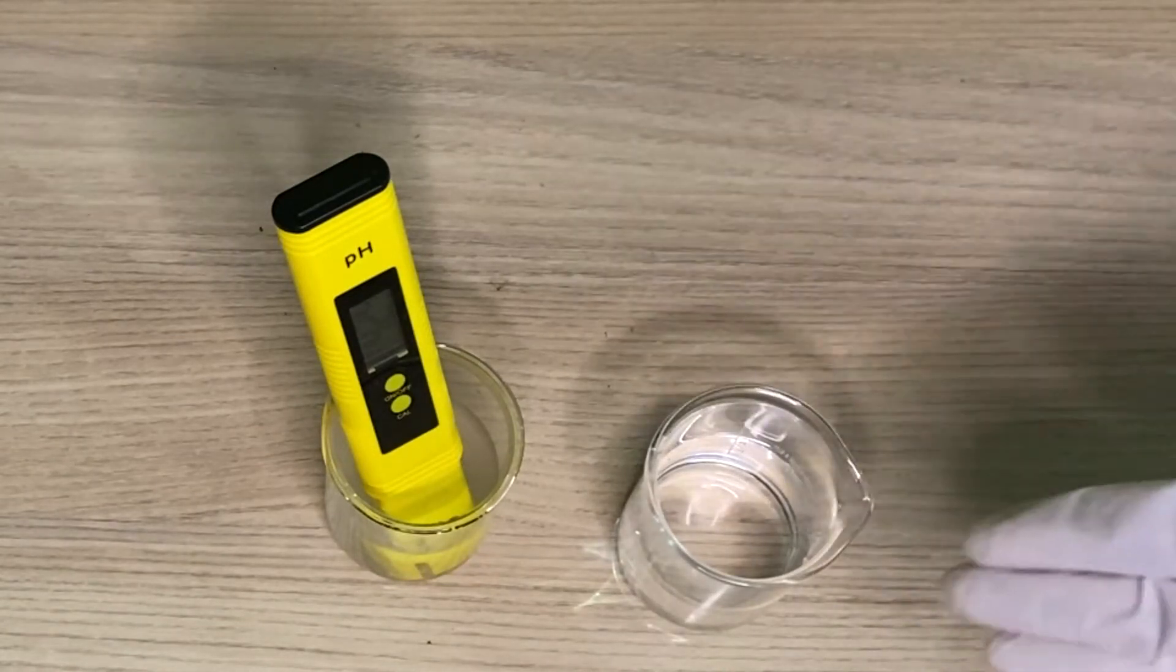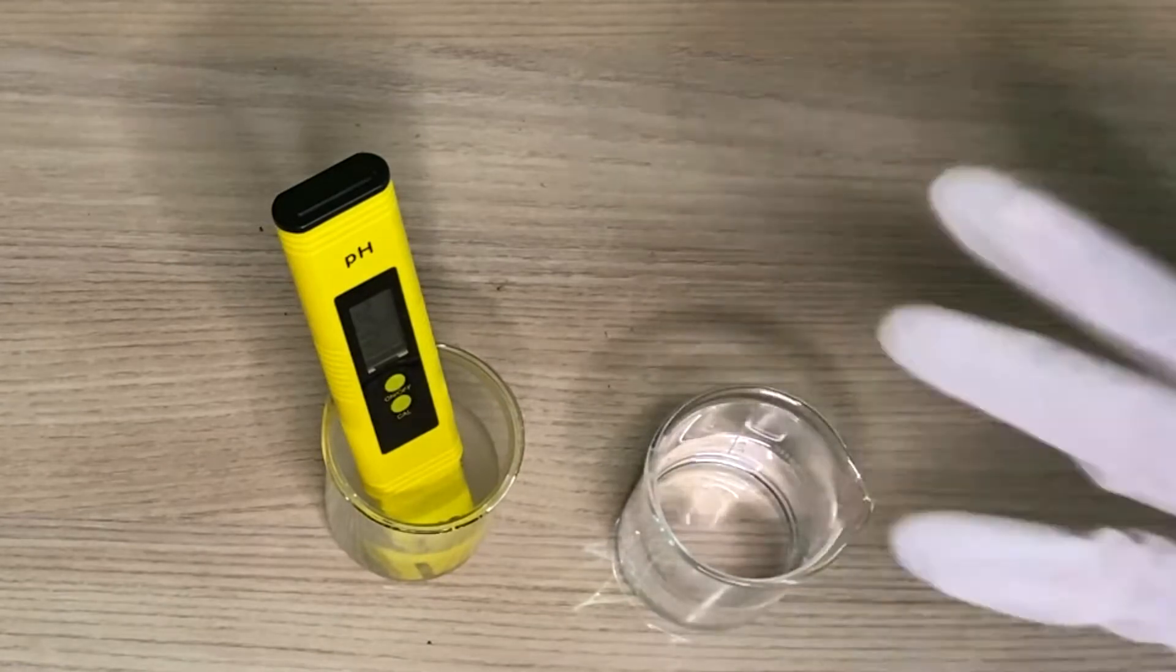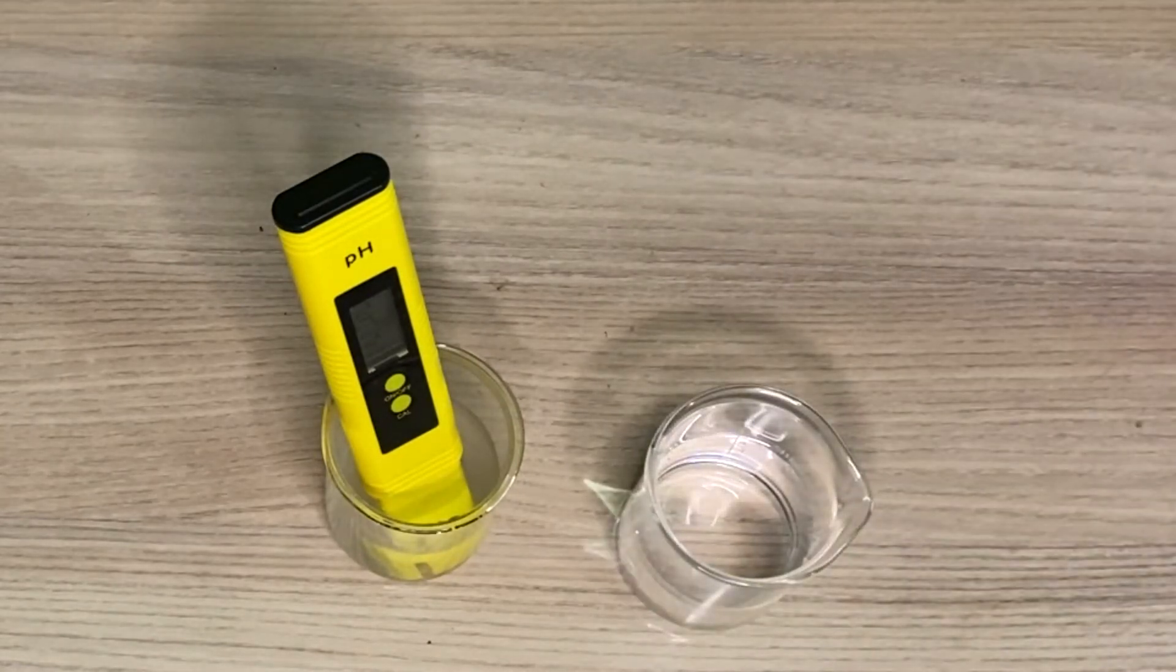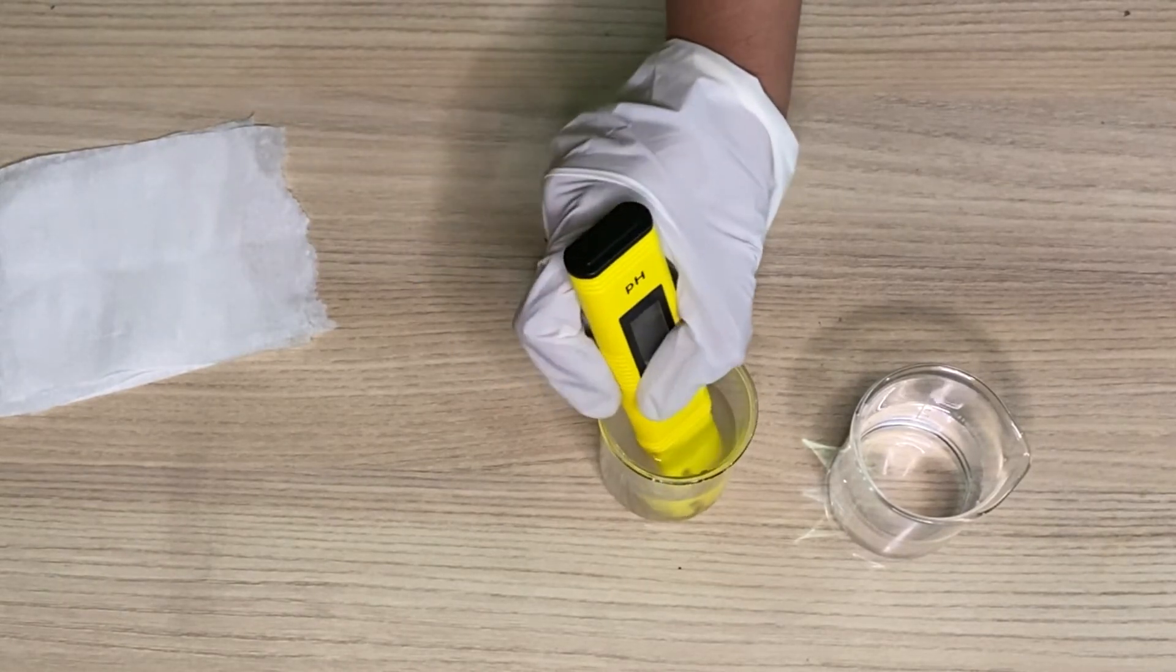If we move it again it will change the pH, so let it be stable so that you can note down the pH. Now we will turn it off.